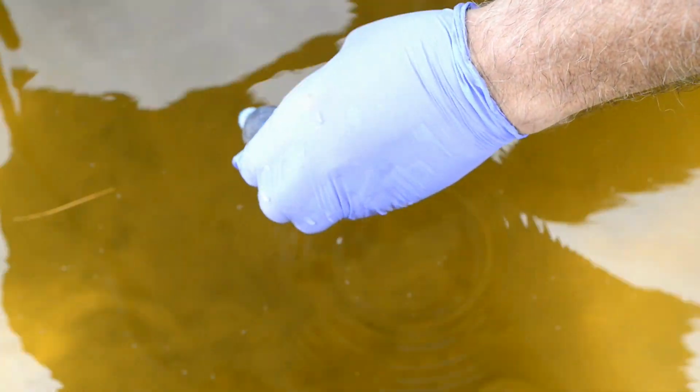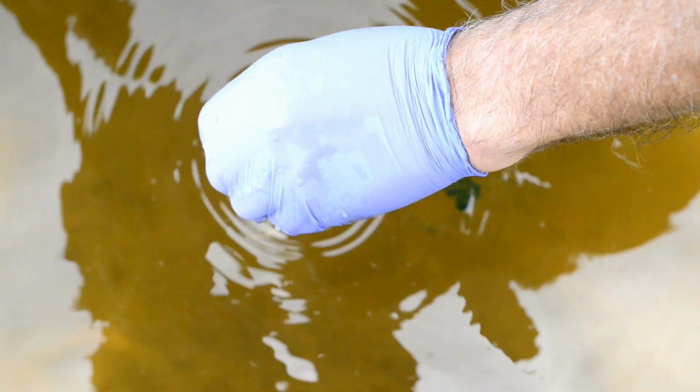So I've got the beaker here, and I'm going to take a surface grab, and I'm going to put some dye down there. So you'll see what happens when we do that. There's some dye, and then what they do is they'll just come in and grab a sample like that, and then you can see the debris on the top.